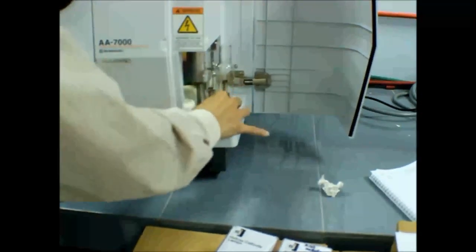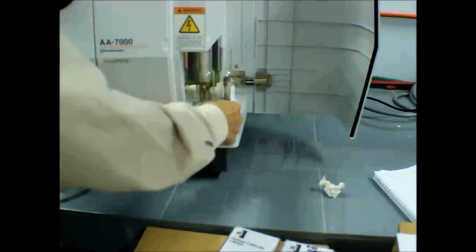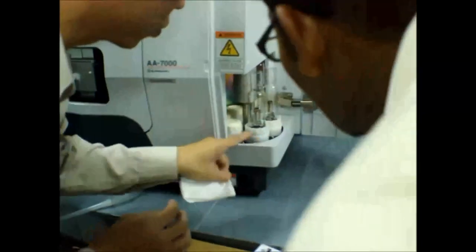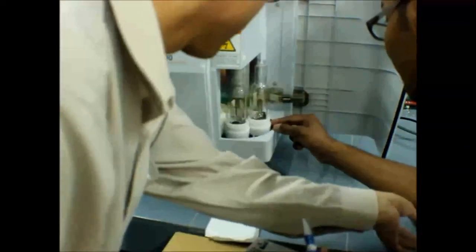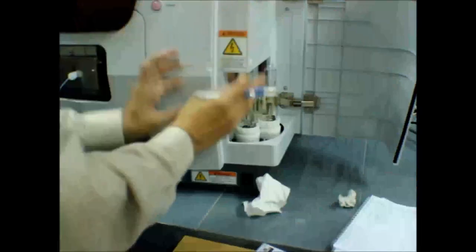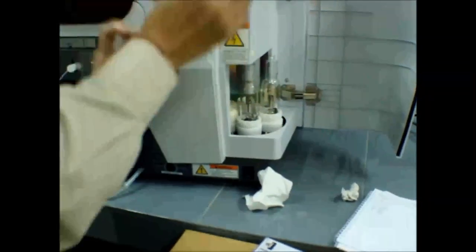Okay. So please write now. Now this is number one. One is mercury. This is selenium. This is copper. Copper is 3. This is mercury. First one is mercury. This lamp, yeah, if you want. If you don't want, you need to change lah.